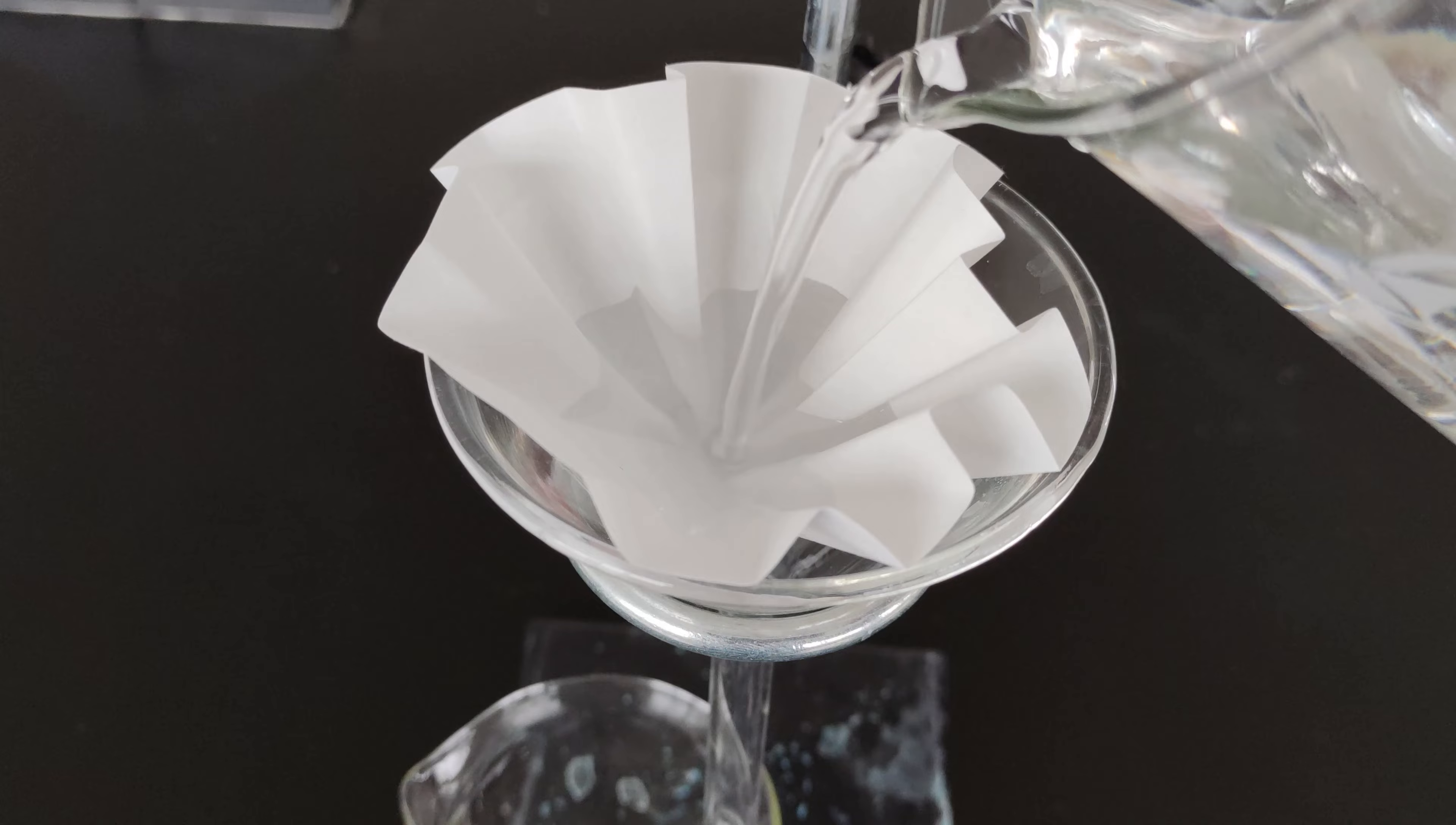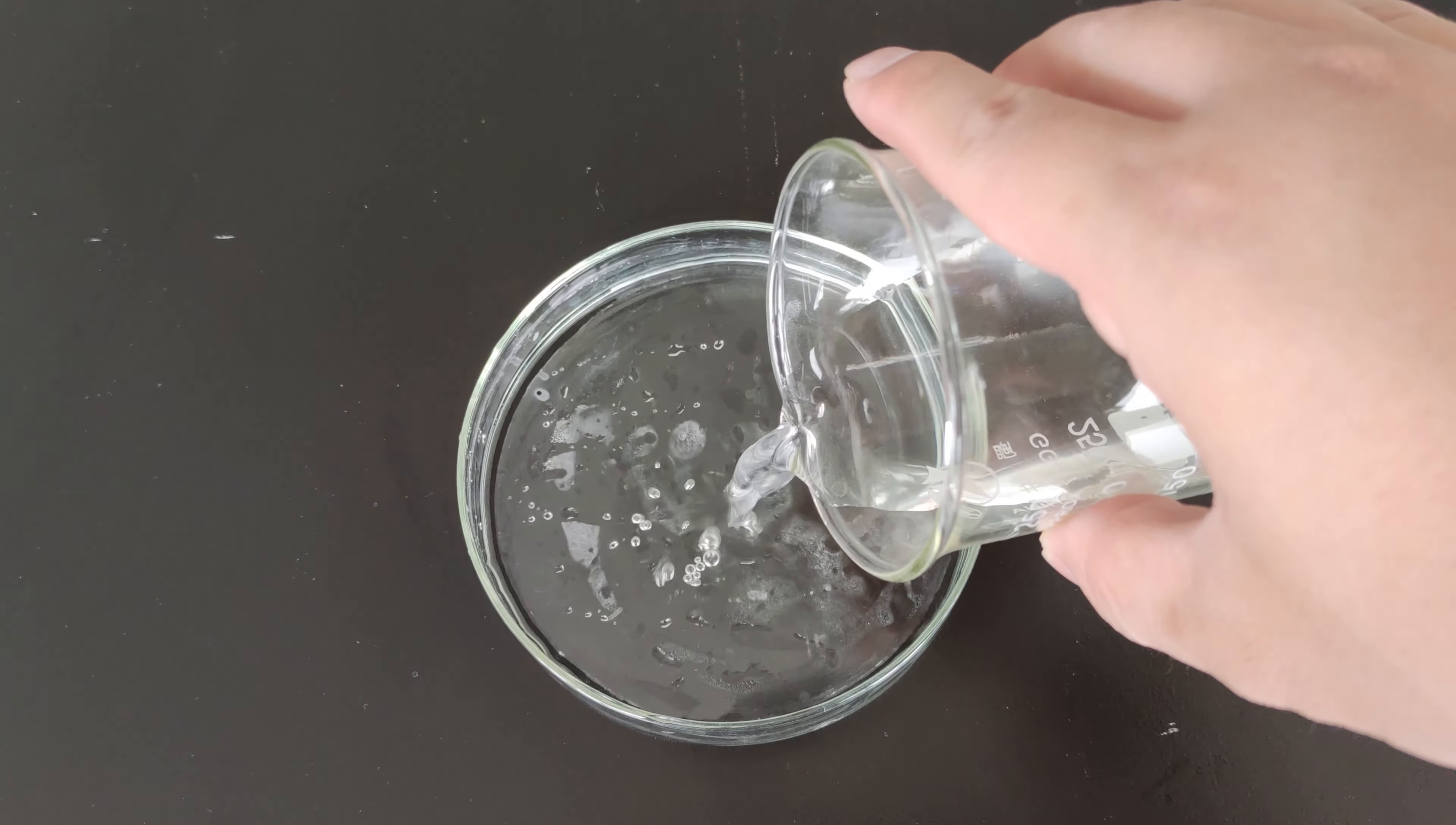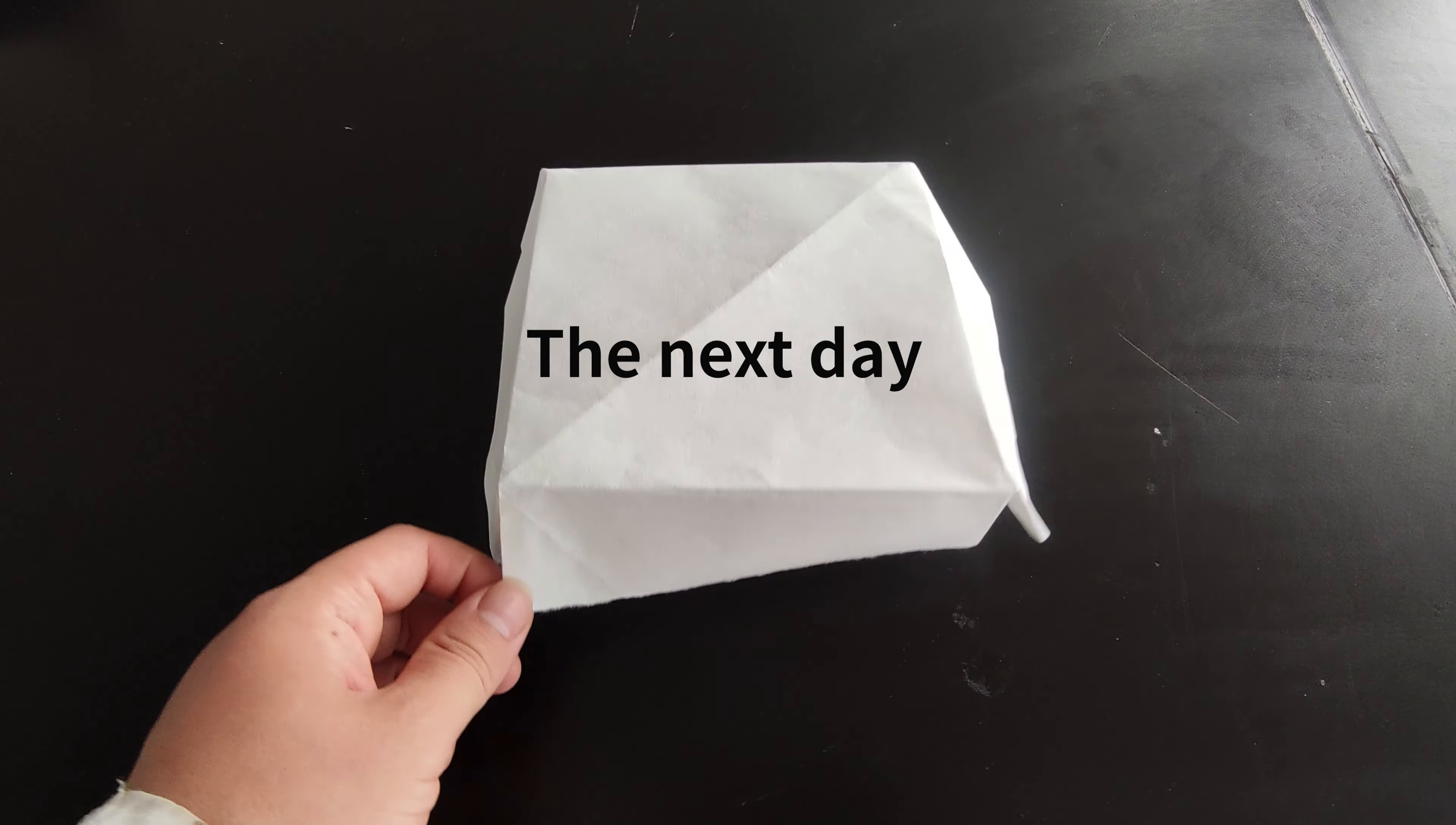Filter if there are impurities. Alright, let's move that saturated sodium chloride solution into a nice, cozy crystallization dish. Time to let the magic happen.